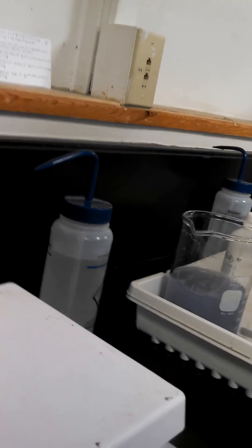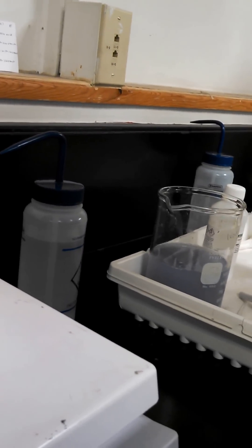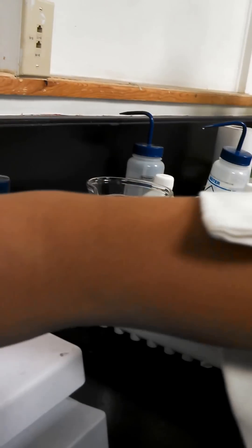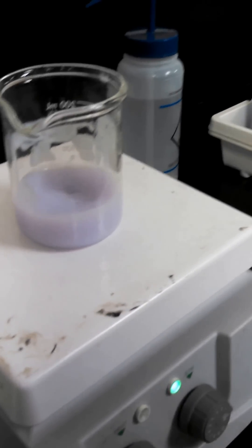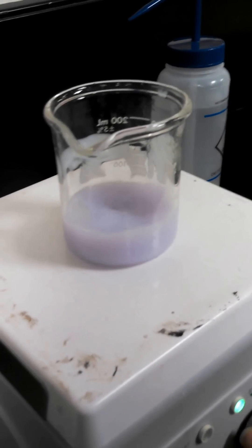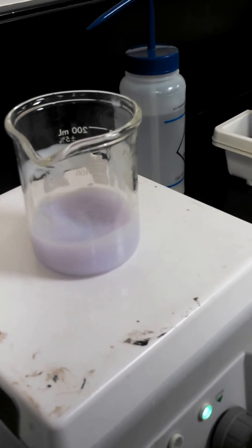Okay, so where's that wooden thing we did? This is already. Oh, okay. Wanna stop it first before you do it? Yeah, we should have probably stopped it first. What? Yo, what's inside it? A magnet. Oh, okay. Some sand.